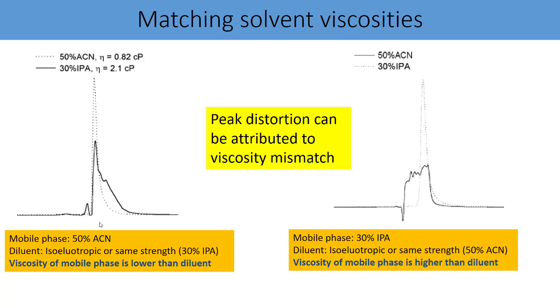Now you may be thinking that this may be the reason because my mobile phase viscosity is lower than the diluent viscosity. But look at the right side onto your screen, where your mobile phase is 30% IPA and diluent is 50% ACN. Now in this case, mobile phase is having much higher viscosity than the diluent. But still, you will find that the peak shape with the 50% ACN is very much distorted. So what is the reason behind this distortion? Now we cannot reason with the solvent strength, because in each example you have actually matched the solvent strength with your mobile phase, but still your peak shape is distorted.